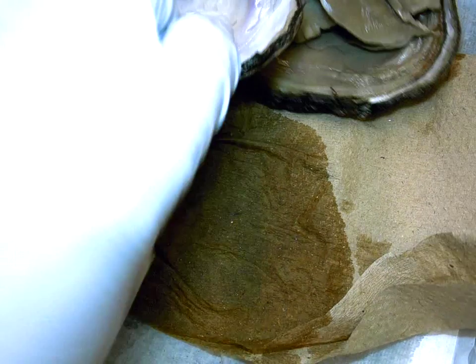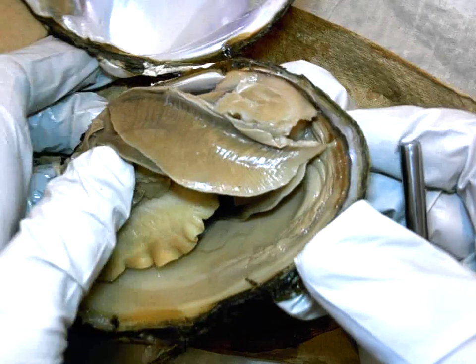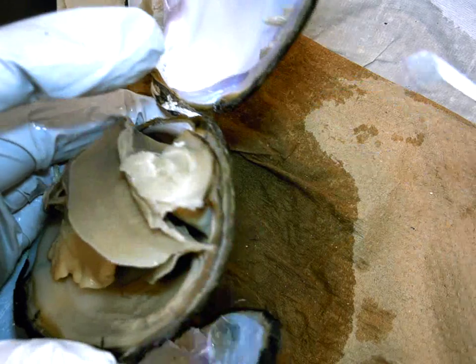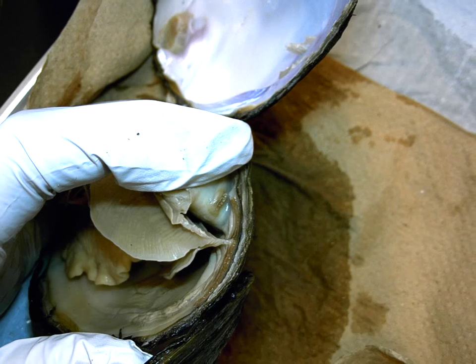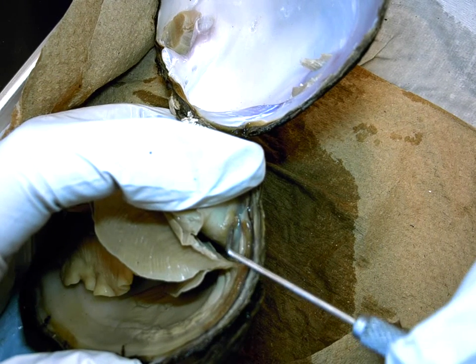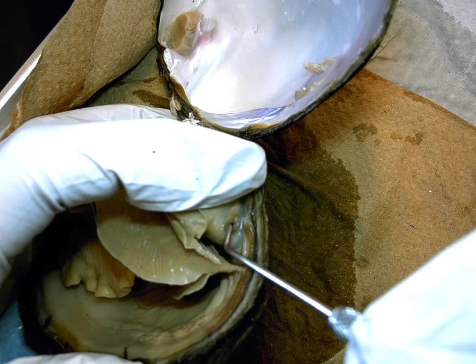Okay? And again, I'll show it just really quickly on the other animal that's still attached to the shell. Again, if I tilt, here are those dark pigmented areas of the mantle. If I tilt the animal right here, right at that location, let me focus one more time, we can see there's an opening here into a tube, and that is the end of the digestive tract right here. Okay.